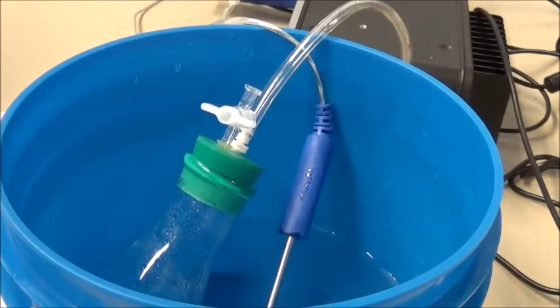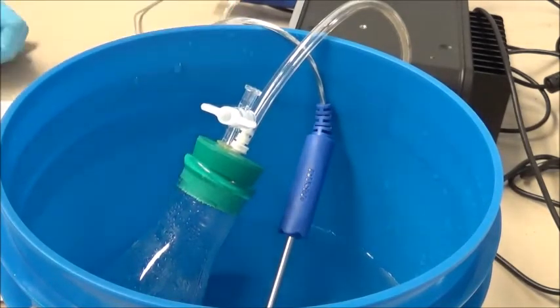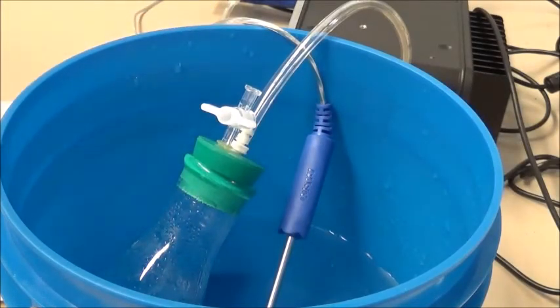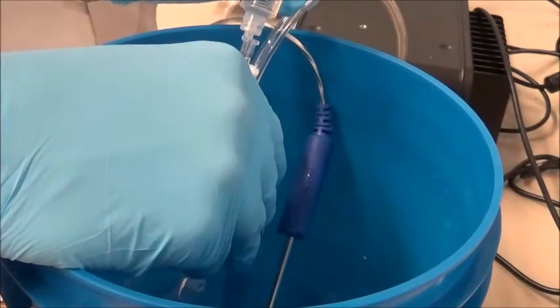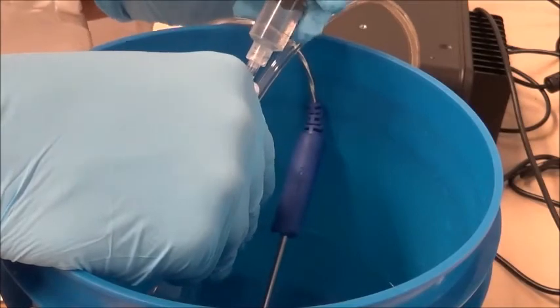Once we have drawn 3 milliliters of the volatile compound into the syringe, we can now screw the syringe tightly on top of the locking port over here. This should be done while the stopper is still in the closed position. So now we'll take our syringe and we'll carefully tighten it on top of the valve locking port.